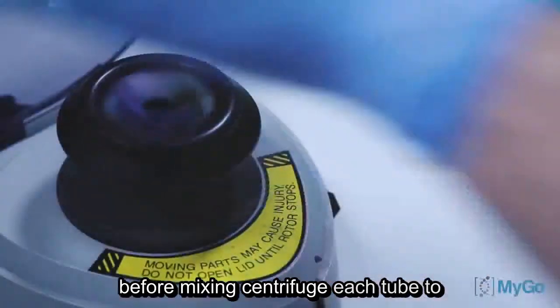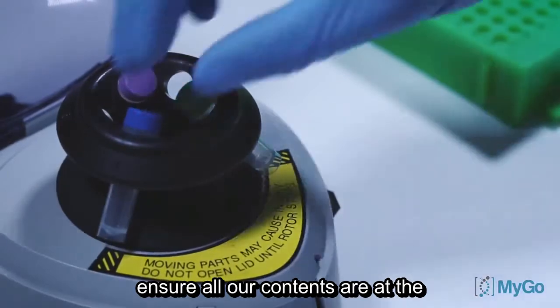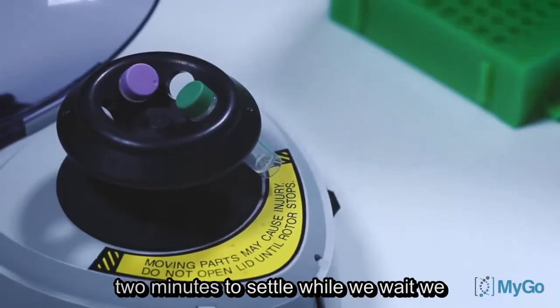Before mixing, centrifuge each tube to ensure all contents are at the bottom of the tube, and then leave for 2 minutes to settle.